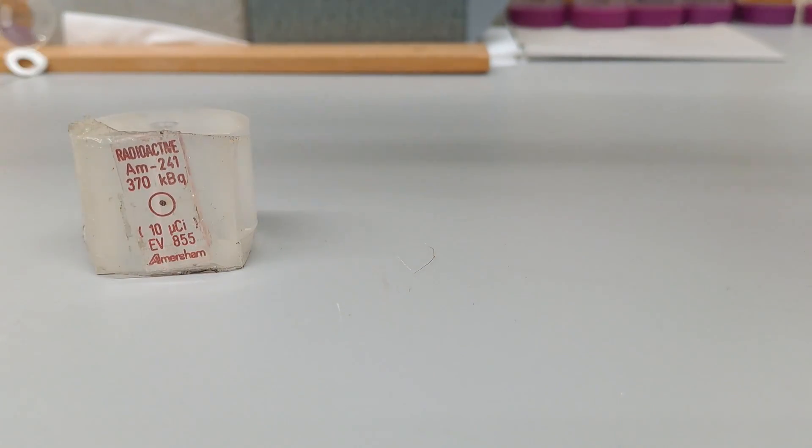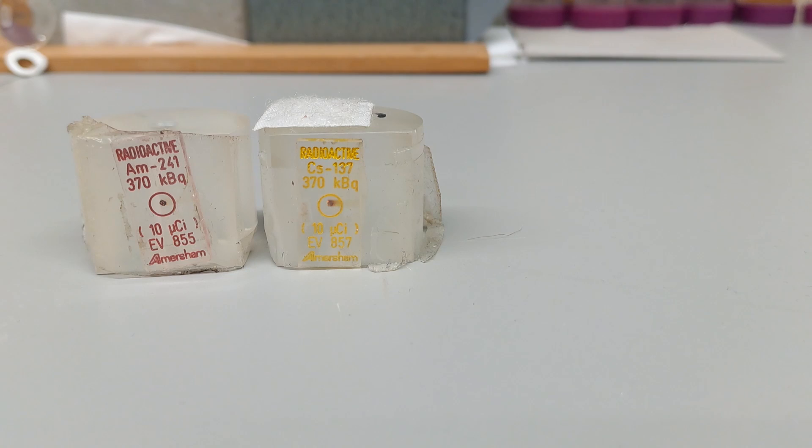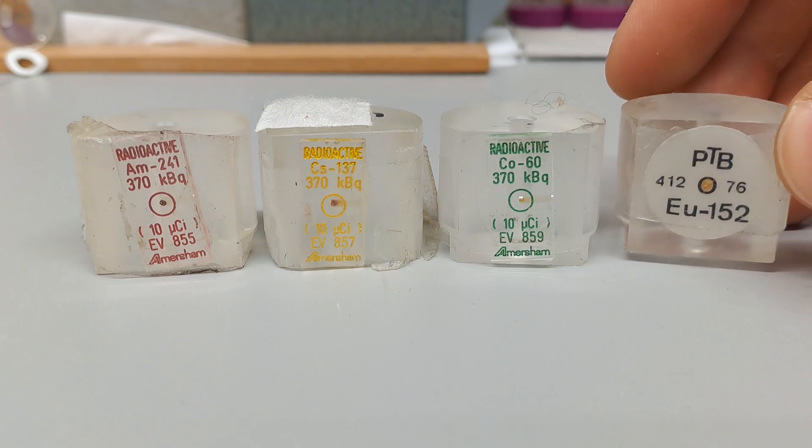For this calibration, we will need the following calibration sources: Americium-241, Cesium-137, Cobalt-60, and Europium-152.